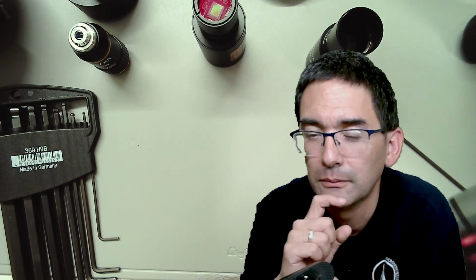That is very hard with a telephone. Well, I don't fully understand this question, I have to admit. Maybe you can be a little bit more specific. Yeah, okay. So this is basically some suggestions that I have here.